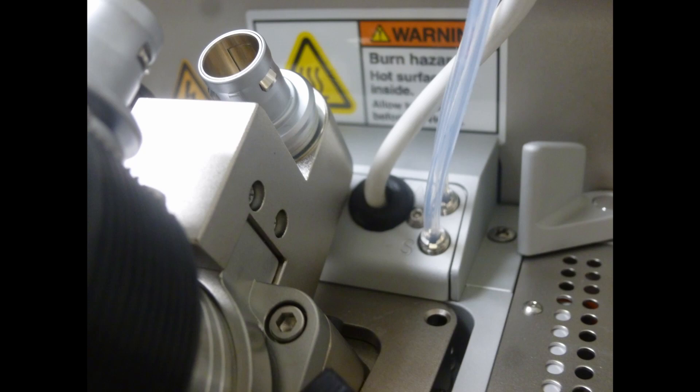If you're ever uncertain which tube is which, look at the engravings on the instrument. They're engraved A for aux and S for sheath.